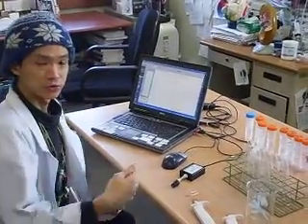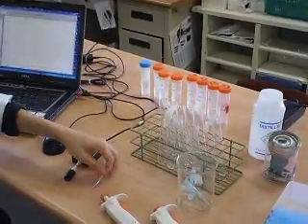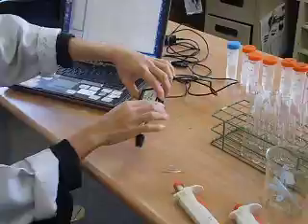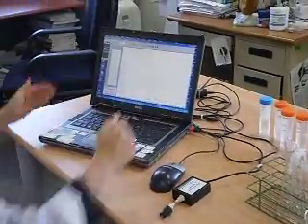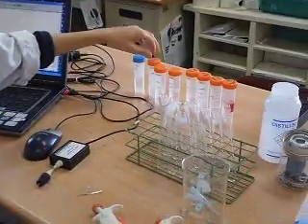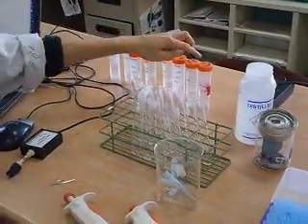Lawrence here. What I'm going to do today is demonstrate the rate of reaction between magnesium ribbon and hydrochloric acid. I'm going to use a gas pressure sensor, and it's all linked to my laptop. First, I prepared a hydrochloric acid serial dilution from 1 M, 0.5, 0.25, all the way down.